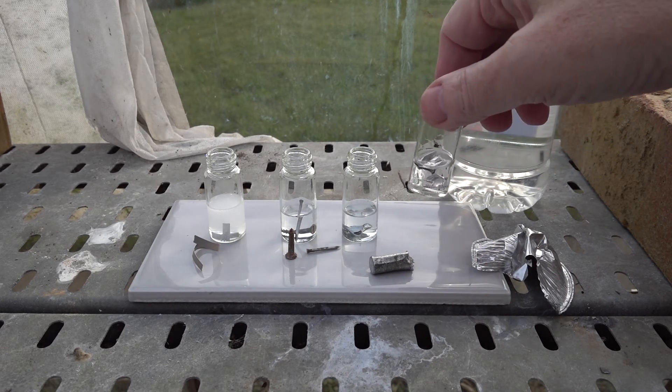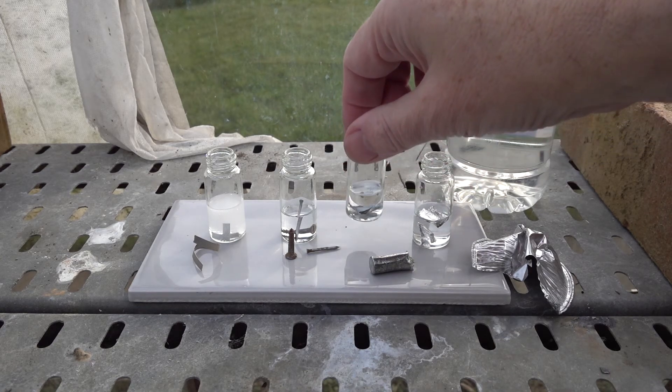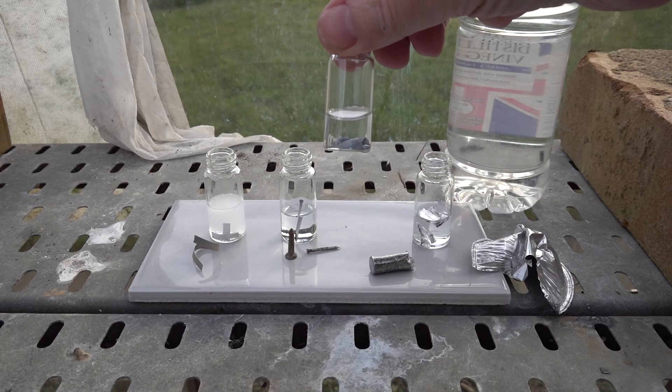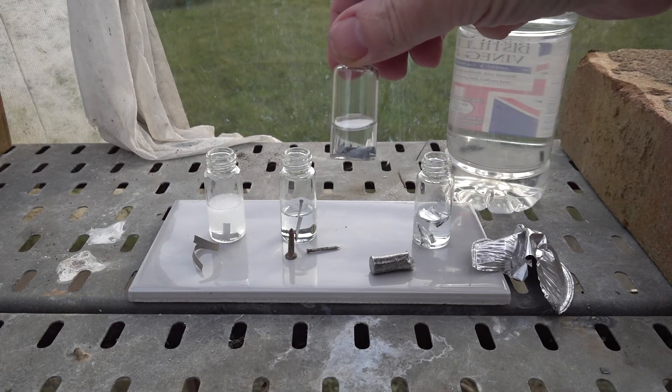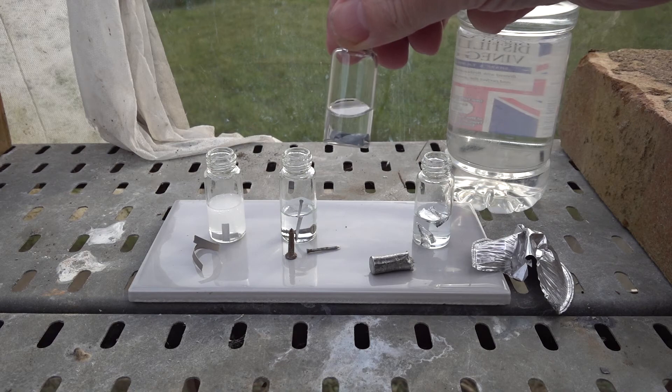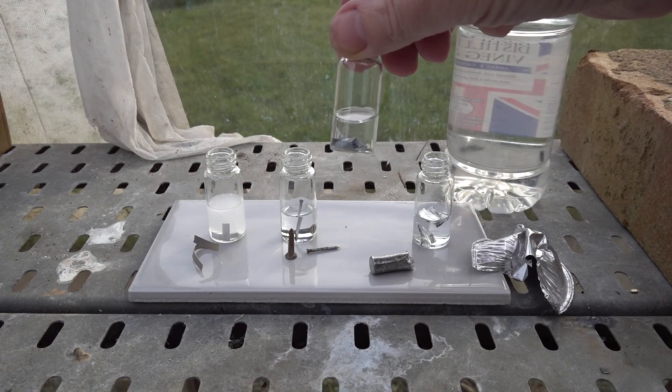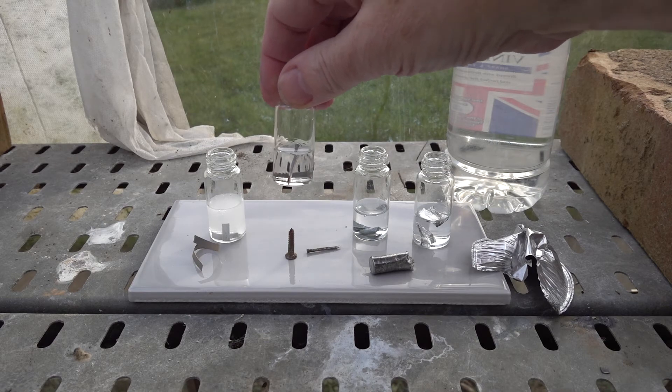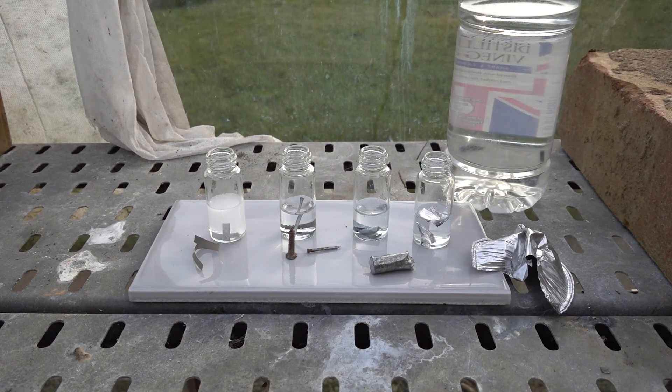Three others are not showing sufficient signs of reaction. Maybe something off the zinc there, very slow evolution of bubbles. I don't think you'll pick that up on camera. So we need to come back to those and have another look in a while.